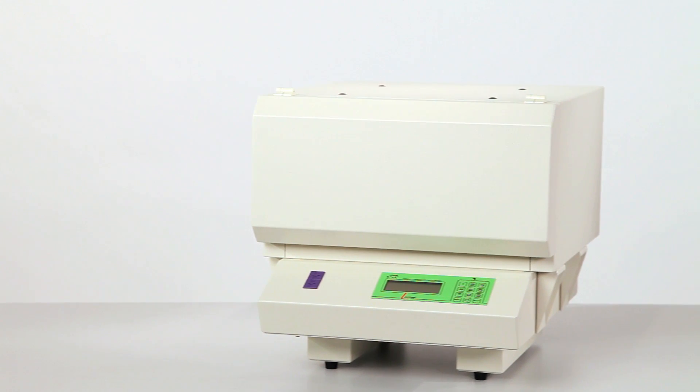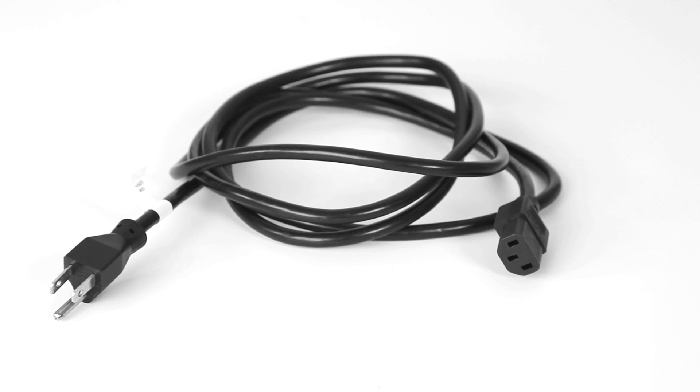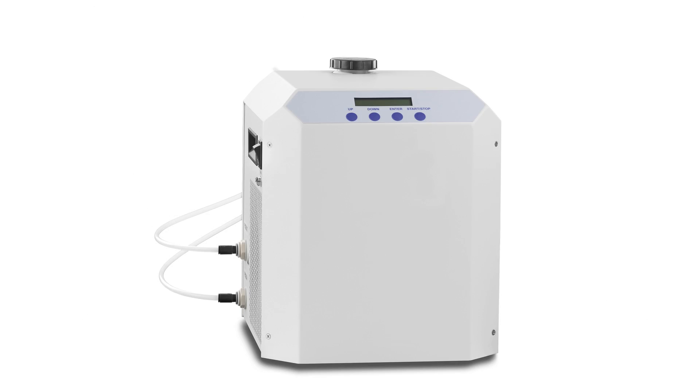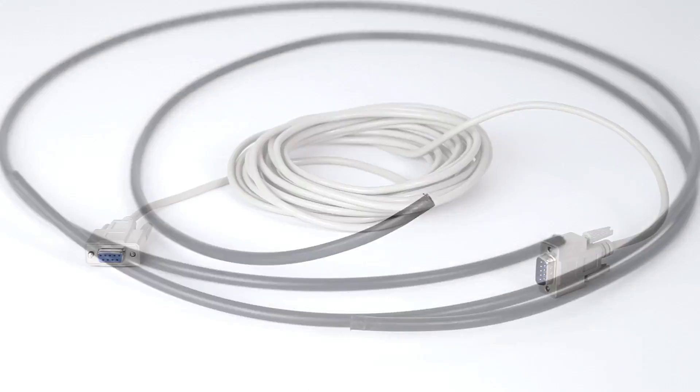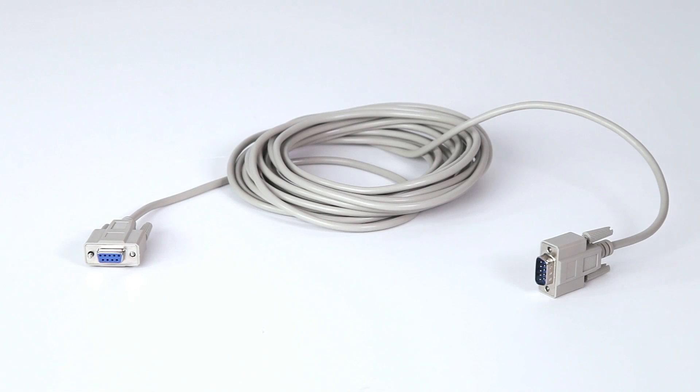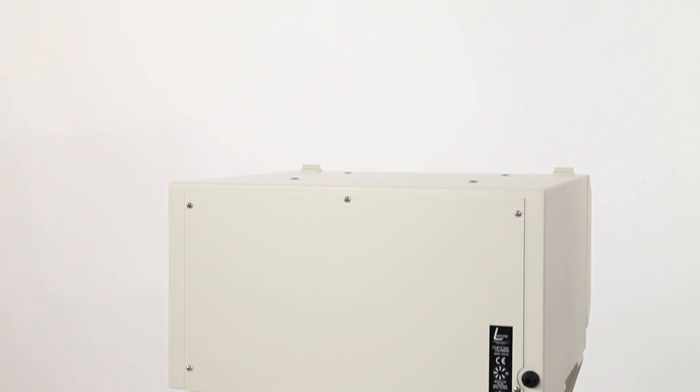Before we begin installing the instrument, make sure you have the appropriate power cord, a chiller, 10 feet of plastic quarter inch OD water hose, and an RS232 cable to connect the instrument to the computer. With these, we can now start the installation.